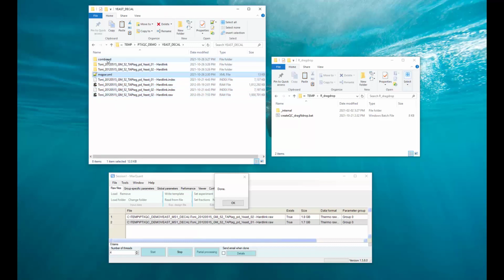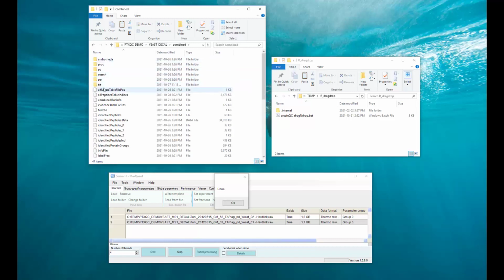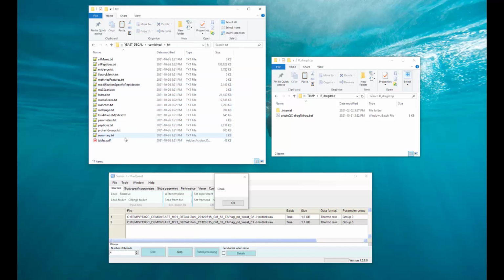So I'm just going to copy the file, and then now we're going to look at the txt folder, which is here under combine txt. Those are the files now which PTXQC is going to read and derive the metrics from. So we're just going to paste the mqpar file here just to make sure those files now belong together. We could go even fancier and copy the txt folder somewhere else just to make sure that they stay in sync. We're not going to do that for now.